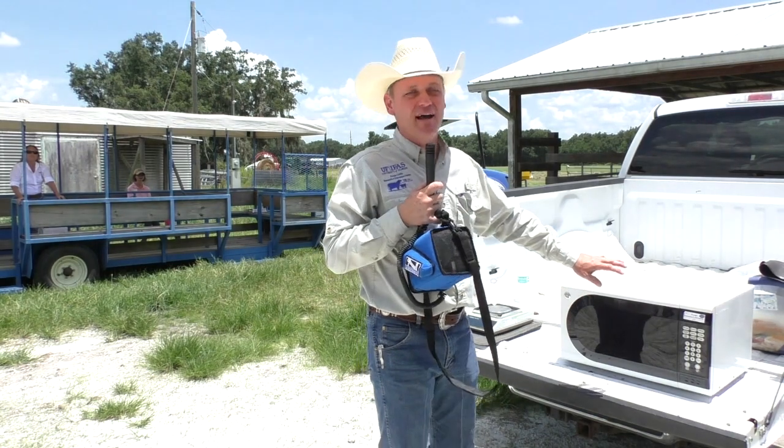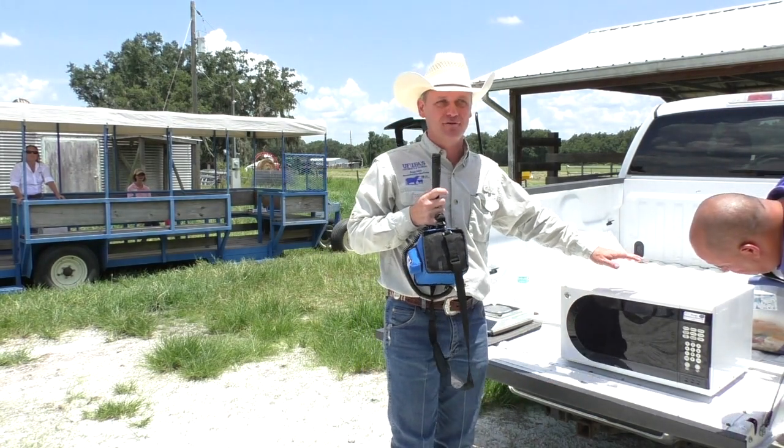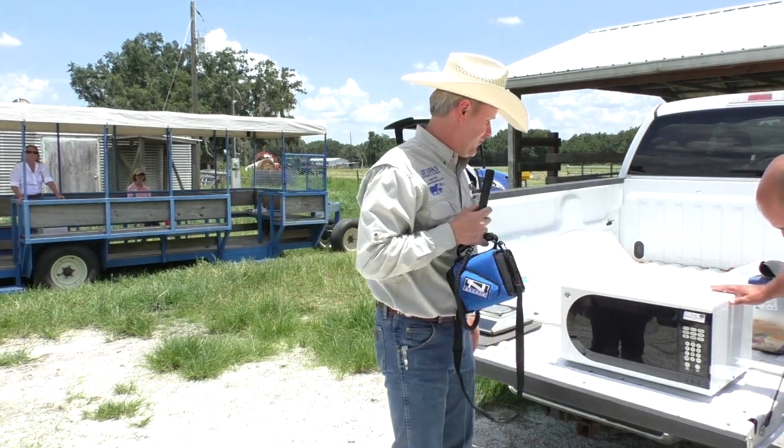We are doing one-minute cycles. Now we're going to switch to 30 seconds, just to see how it goes.